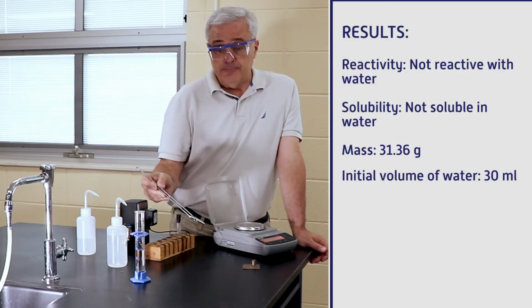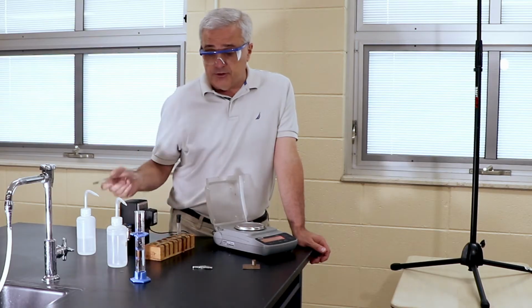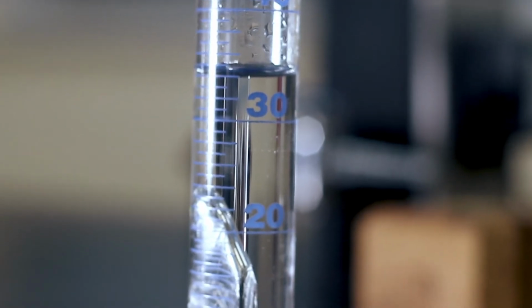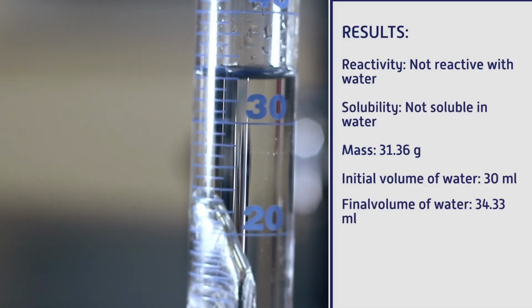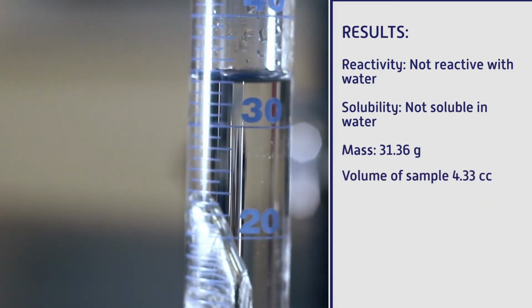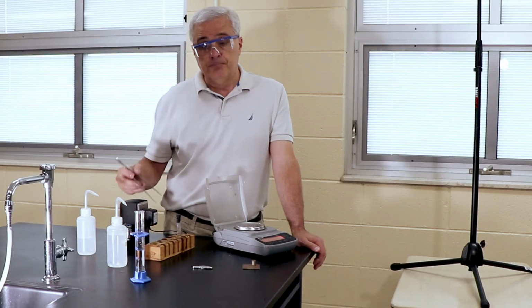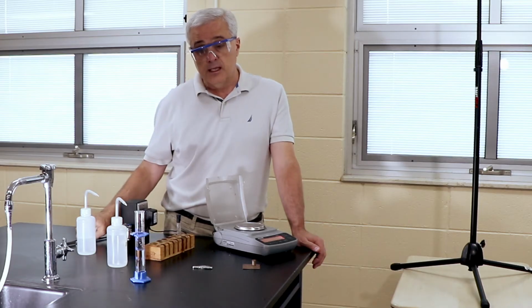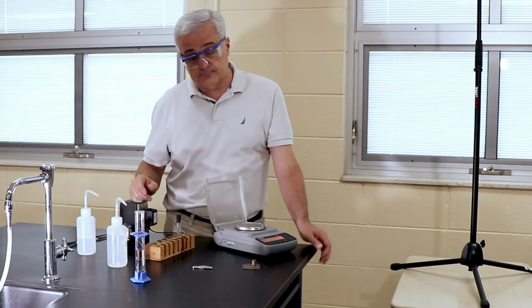Now, after we put the sample in, we had to find the final volume, and it was a little bit between 34 and 35. Extrapolating the lines on the graduated cylinder, I'm going to call this sample having a volume of 4.33 milliliters, which is cubic centimeters. So we have a mass of 31.36 and a volume of 4.33. In the conclusion, we will calculate that and discuss what that means.